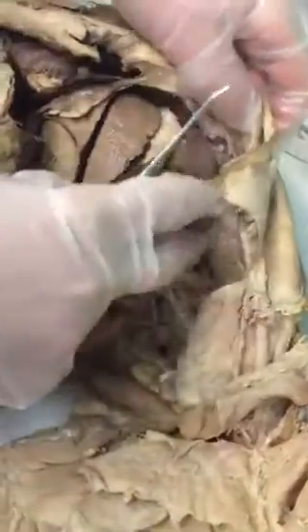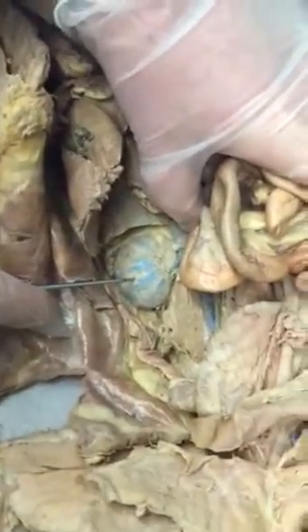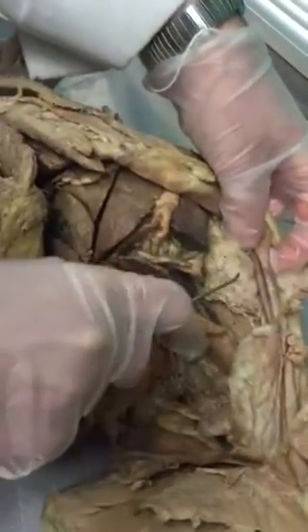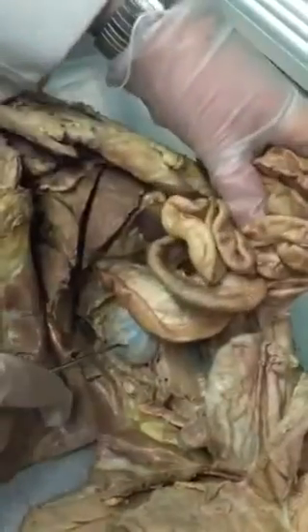Okay, then you have the kidneys on the back wall of the abdomen. You have the left kidney, and then you have the right kidney. Remember, the cat has the opposite orientation. So that's the left and right kidney? Yeah, any organ where there are 2 of them, you have to indicate left or right. This is the left kidney. It's your right, but it's the cat's left. So this is the left kidney, and this is the right kidney.